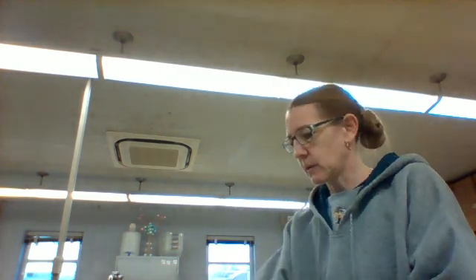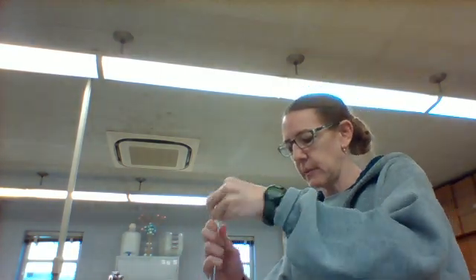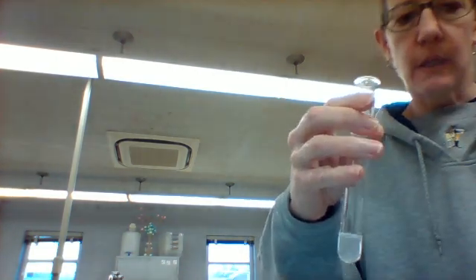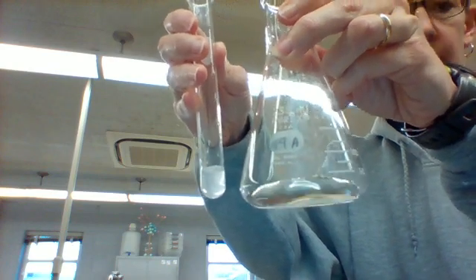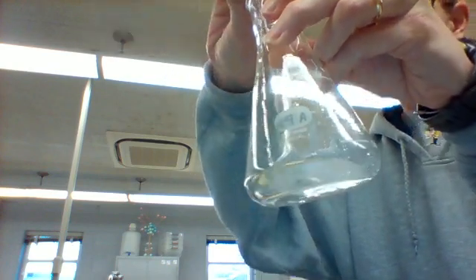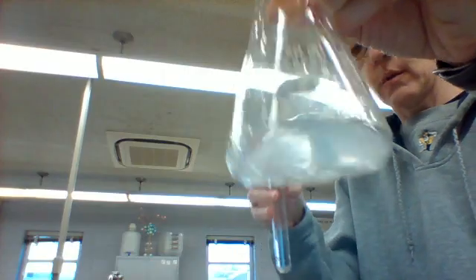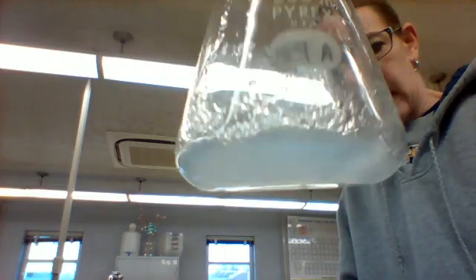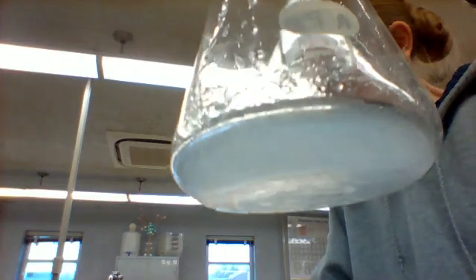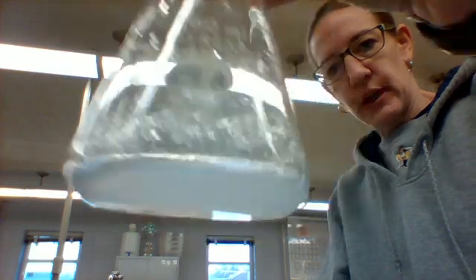My calcium chloride is in this test tube. I labeled it so I would remember, and I'm going to pour it in here so that you guys can hopefully see what's going on. We've got these 2 clear liquids. We're going to combine them, swirl them around, and hopefully you can see that it's getting really thick and kind of gooey. We definitely have had a change there.